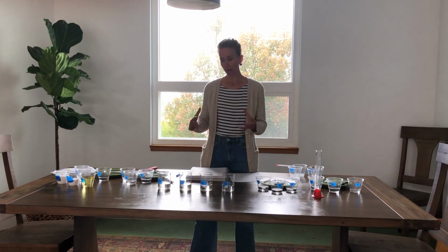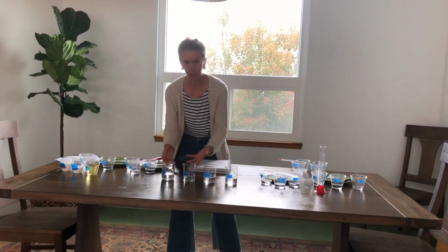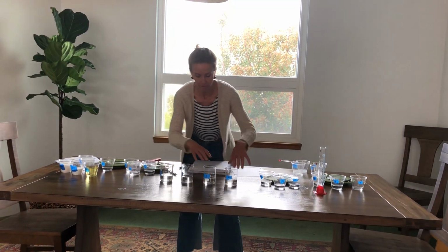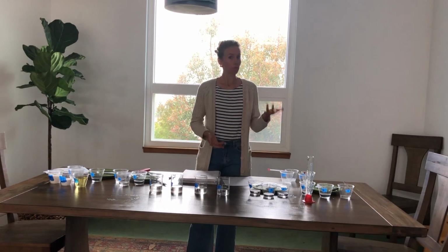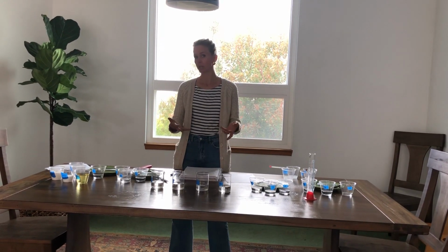Today we're going to explore our same topic of physical and chemical properties to identify 4 mystery liquids. You can see that we have 4 clear liquids here. I showed you these in the slideshow before, 1, 2, 3, and 4, and they look pretty much the same. So we're going to use 4 properties to try and determine what these are.